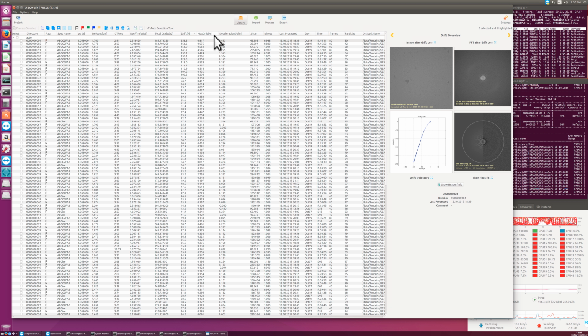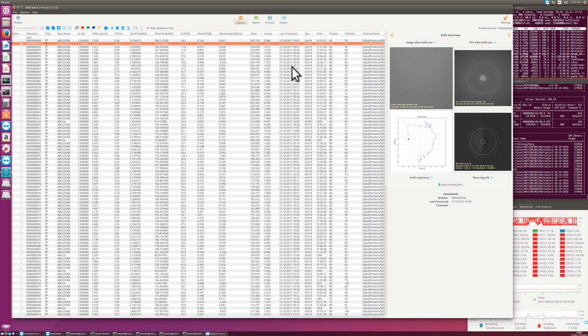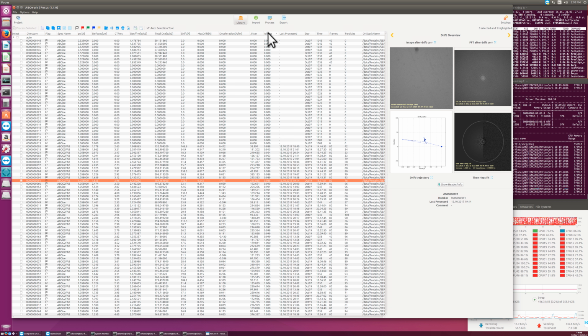Seems to be okay. We can sort this by jitter. Jitteriness is how straight or not straight this drift profile is, and this one has a very high jitteriness, but that's because there's almost no drift, so that would then be okay. And if you have a high jitteriness and a lot of drift, then there's something odd, like this one here. So for example, this has a jitter of 255 and drift of 14 nanometers, and that's a very suspicious drift profile.